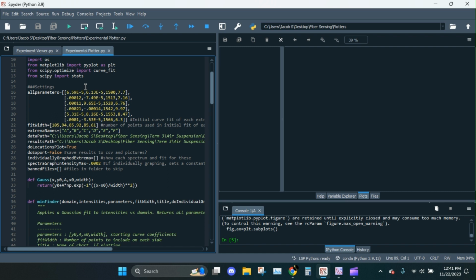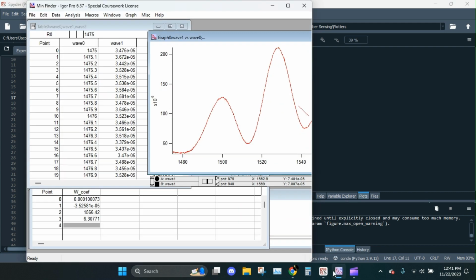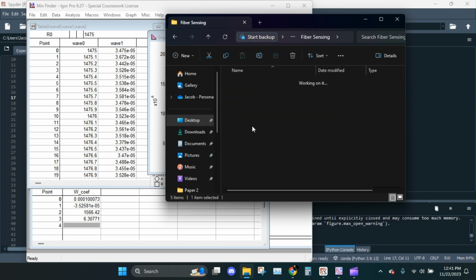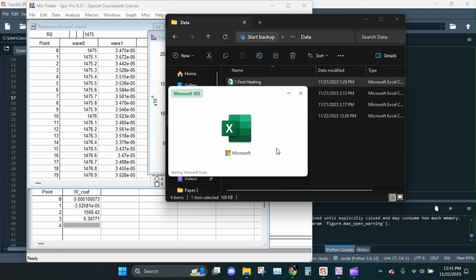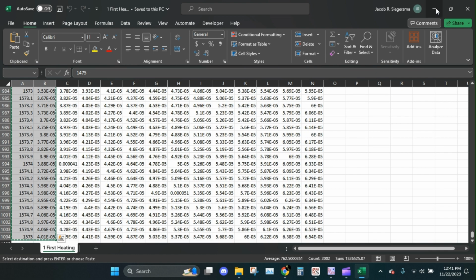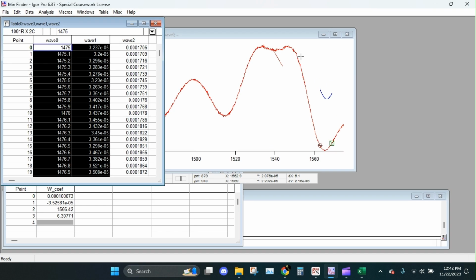Okay? So first thing is we need those initial values for all of the Gaussians. So let's do that. All this is from my previous experiment. I'm just going to get rid of that. So the initial curve fits we can do in Igor. There they are. Wowie. And then I'm going to, once again, open posts, data, first heating. Could have just left this open if I was smarter. And from here, I'm just going to grab the first spectrum and paste it. There we go.